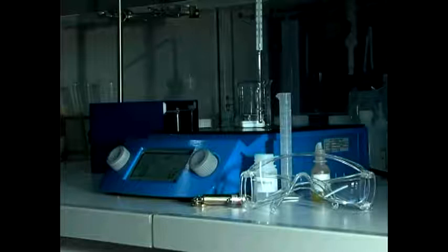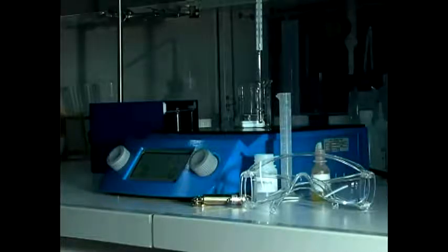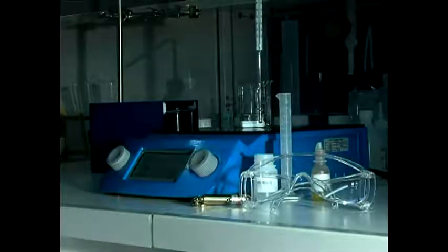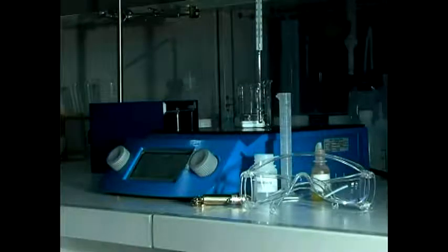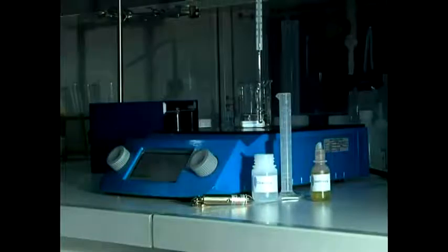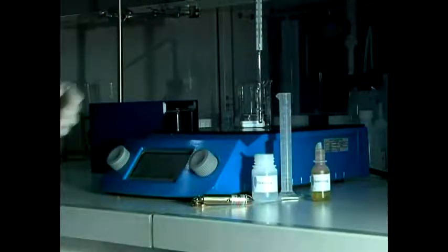For this experiment, you need the gold chloride solution, the citrate solution, distilled water, a hot plate, a stirring device, a fireproof beaker, a heat thermometer, a laser pointer, and a pair of safety goggles.